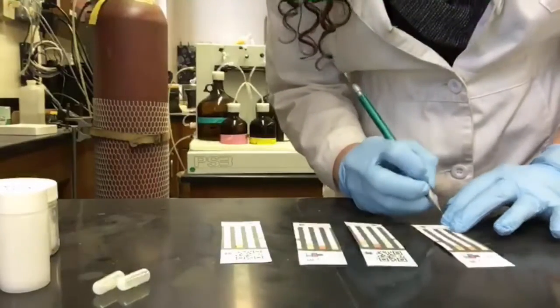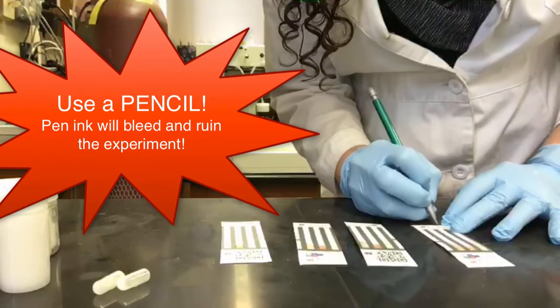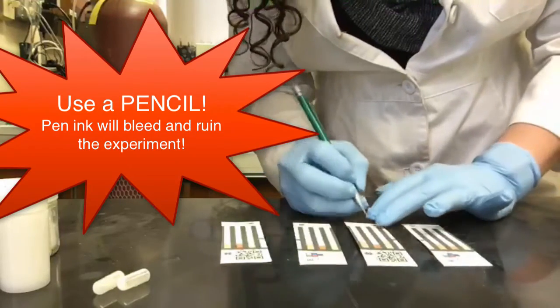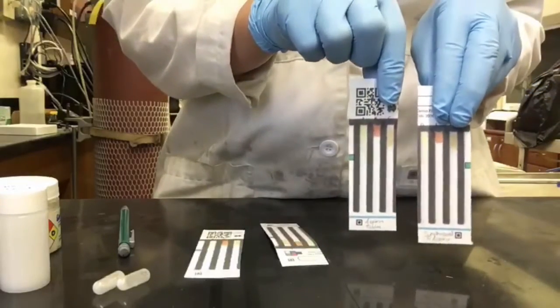Before doing anything else, make sure to label your pads with the component that you plan on testing on each of the pads. You should have 1 labeled salicylic acid, 1 labeled synthesized aspirin, a 3rd labeled aspirin tablet, and a 4th labeled Tums.